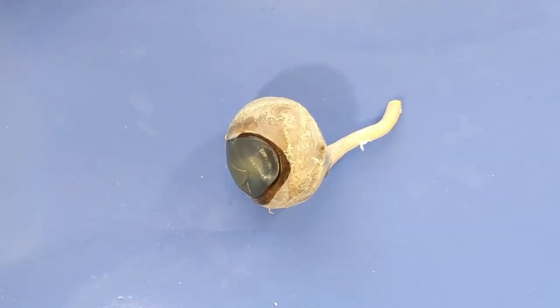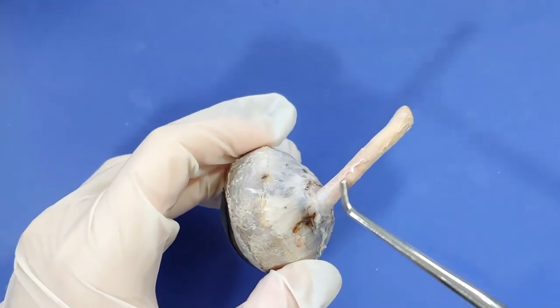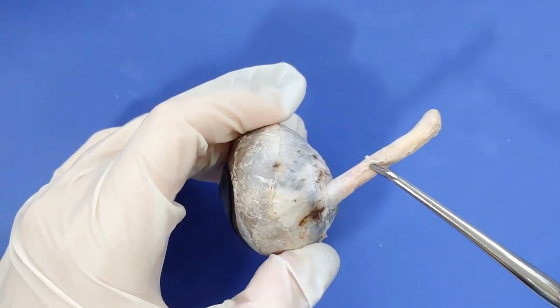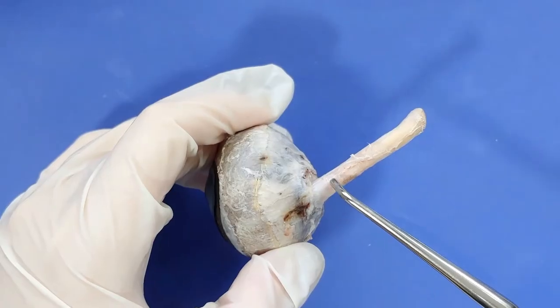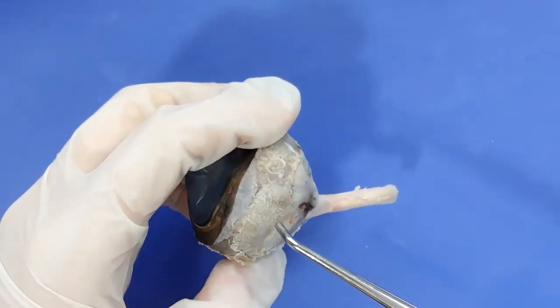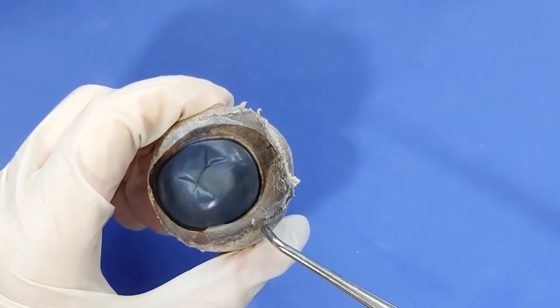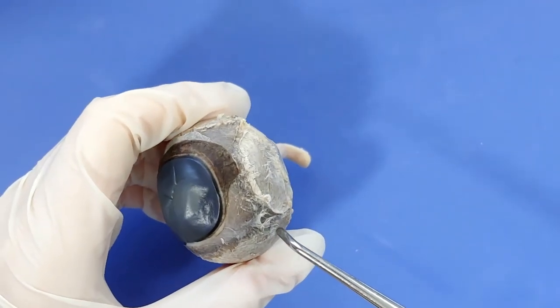So now you can see the eye here, and it's very round. This structure coming off of the eyeball is the optic nerve. The optic nerve is like the highway connecting your brain and your eyes — it transmits visual information from the eye to the brain. This entire white area is called the sclera, also called the white of the eye, and it is the outer protective covering of the eyeball.